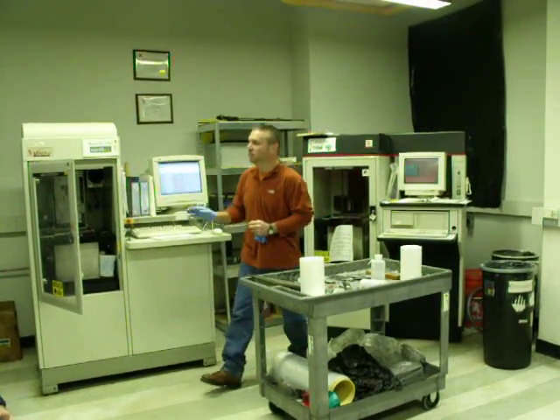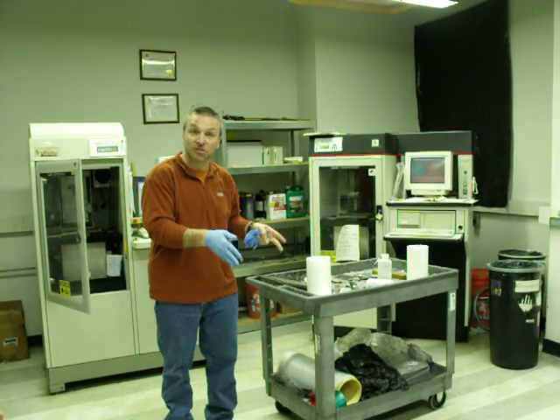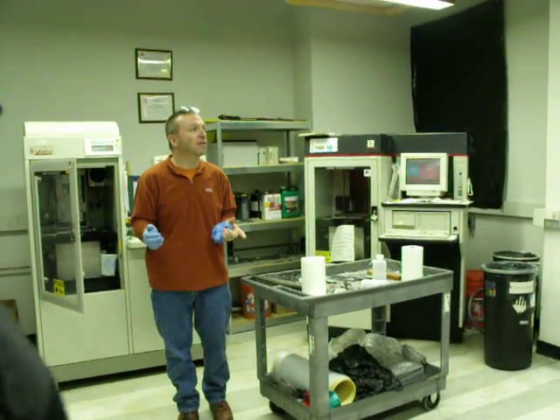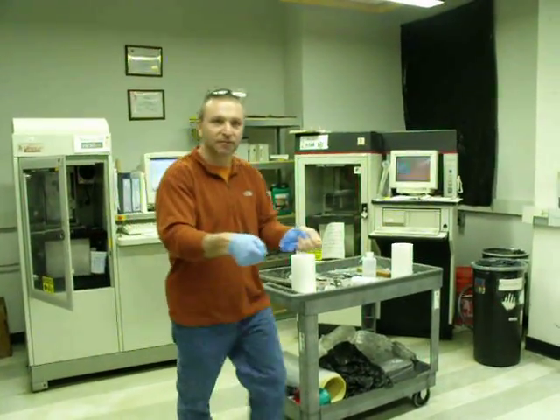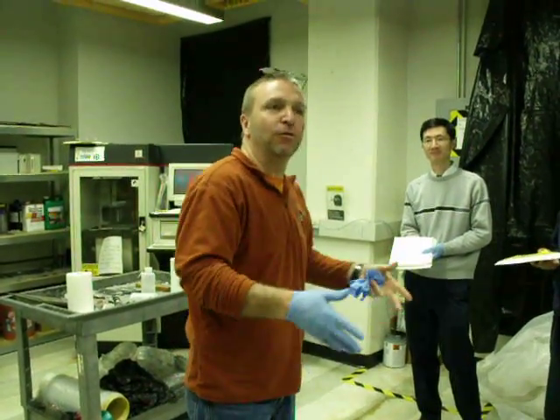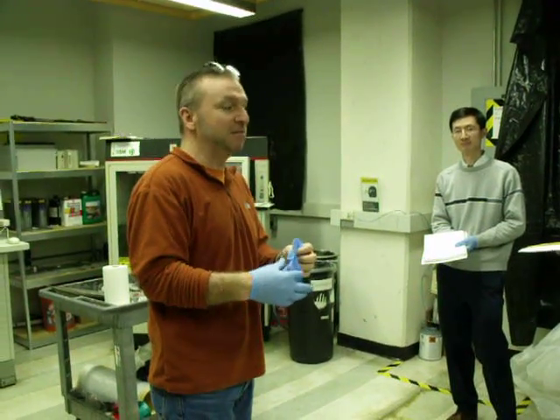But the bottom line is, if we have a rule of no gloves on the outside, then you're not going to have resin on the outside of the machine. That's the starting place. A couple things. When I kind of got the picture that everyone was taking their platforms out and walking like this to the sink. Is that what most people were doing? Some people were doing? Well, there was resin all over the floor. The floor was sticky because there was resin on it. I don't know how it happened, but it was sticky because there was resin on the floor.